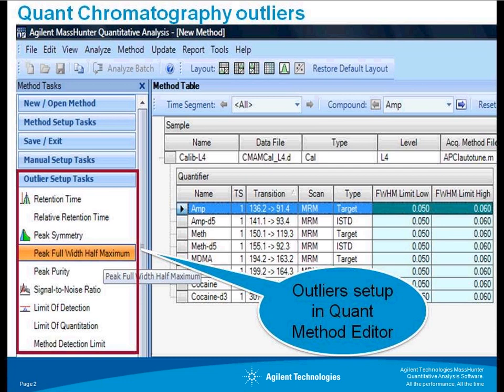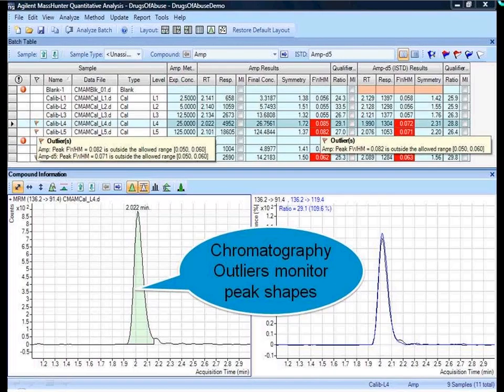you if the concentration is at that level: limit of detection, limit of quantitation, and MDL, method detection limit. I'll mention here that the integration quality metric is not shown in this list because you, as a user, do not establish the limits, and also that symmetry and full width at half height maximum are also measured for the qualifier signals. So let's take a look at one particular outlier, the full width at half height maximum, and use that as an example of setting that up and using that as a chromatography outlier.